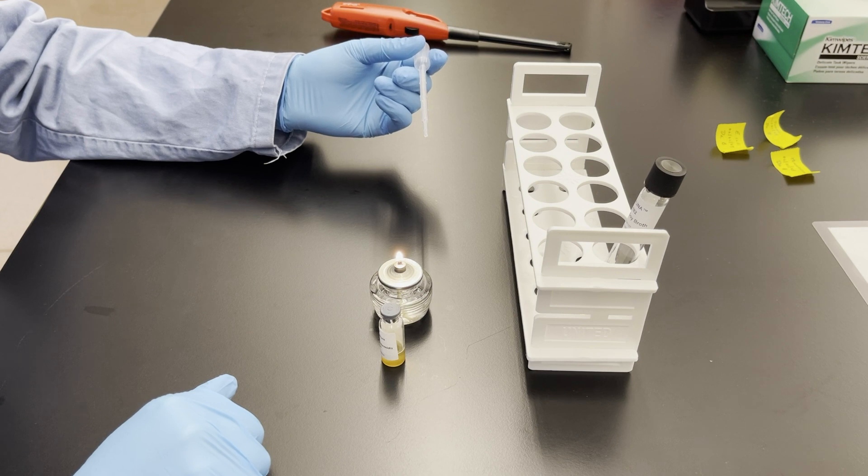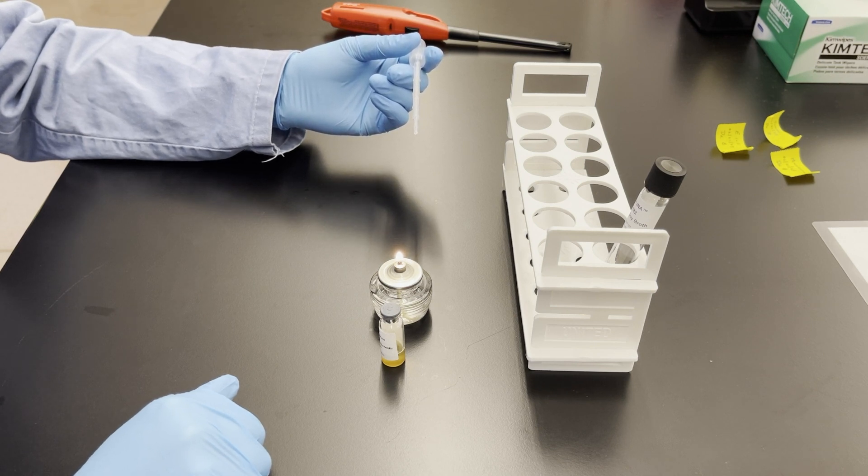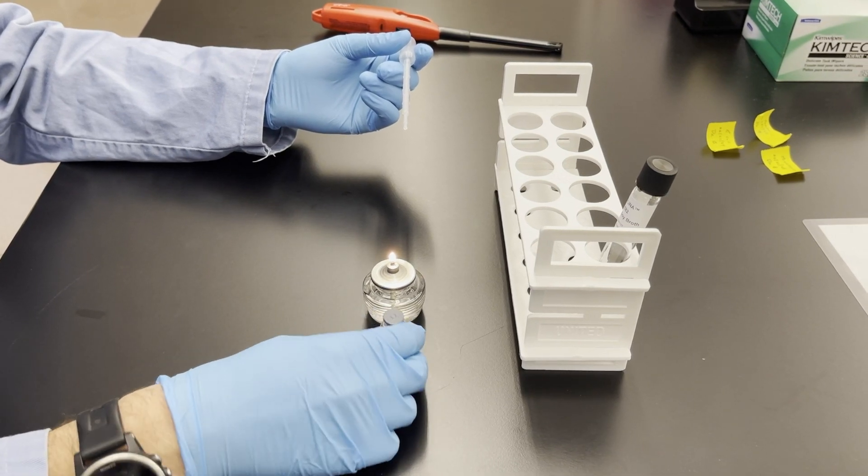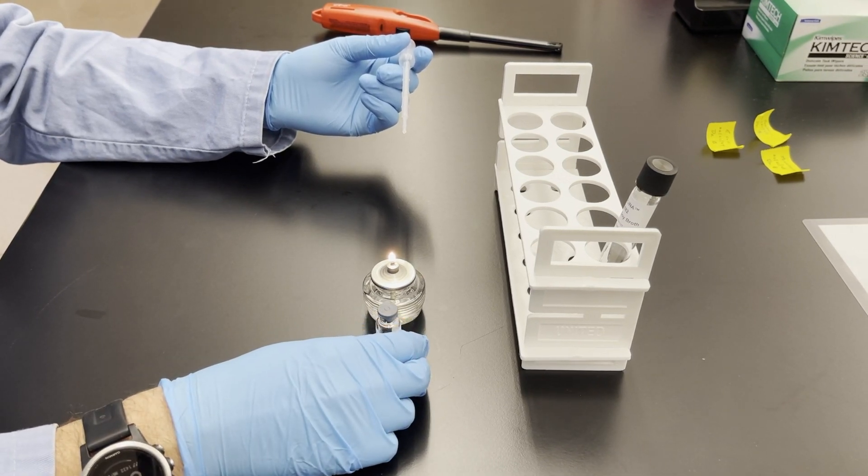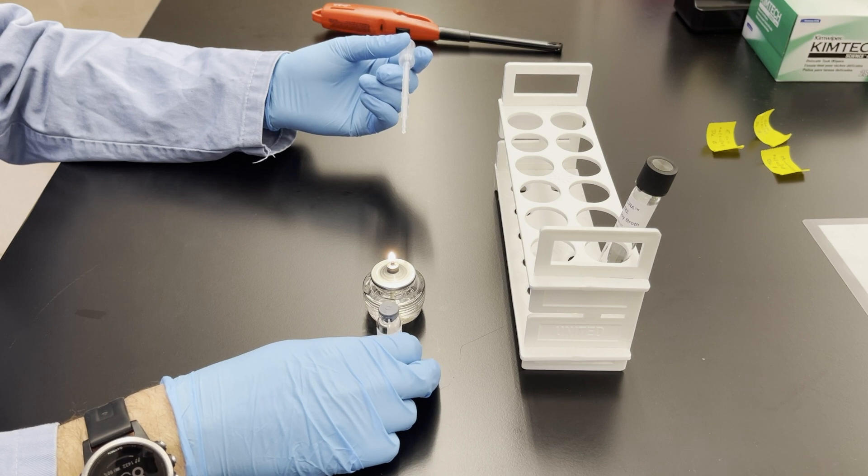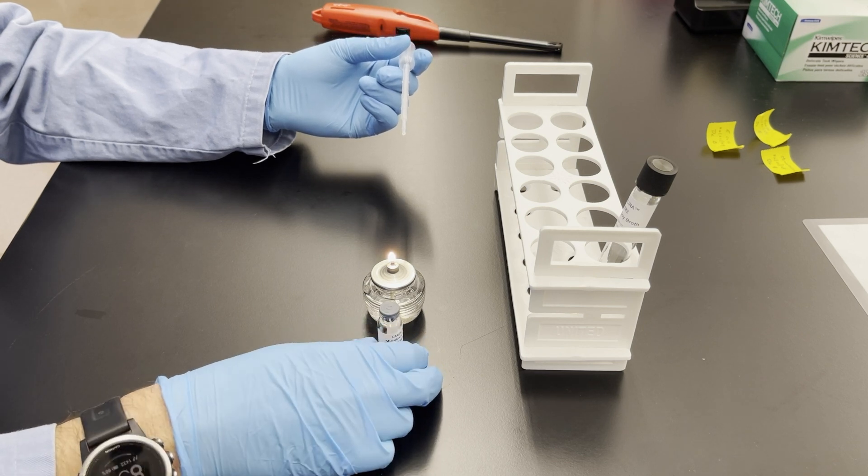So just wait 30 seconds or so and then once that 30 seconds is up, what you're going to do is transfer all of that liquid including the bacterial cells into the media container that we just got our sample from.